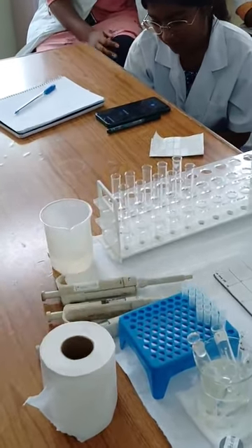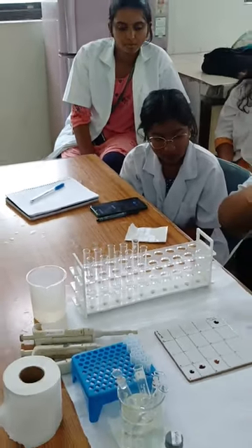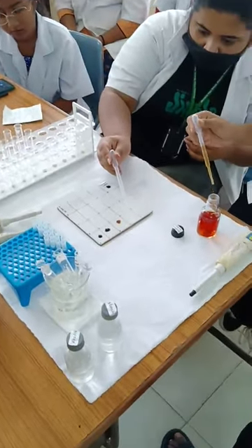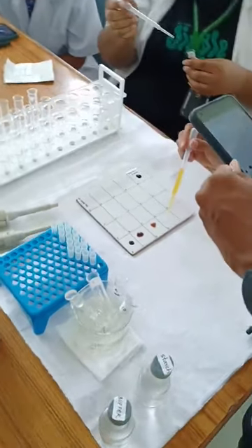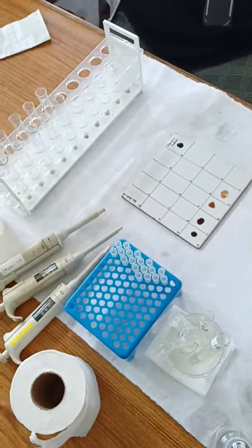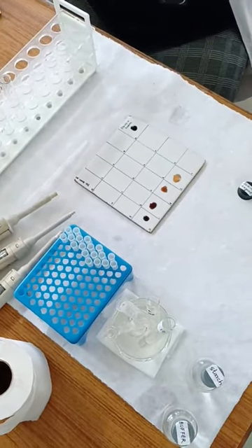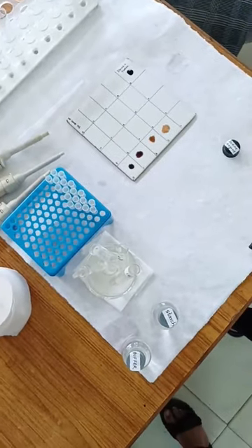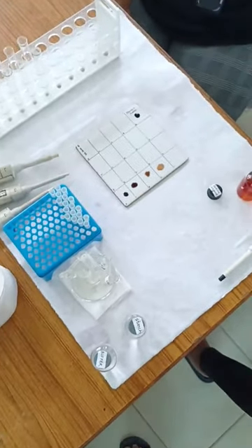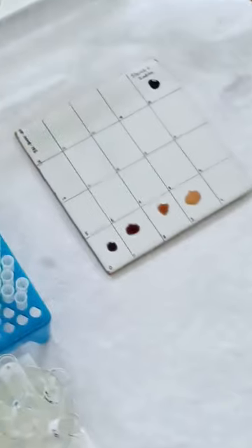This is a simple test to determine the achromic point. Once we find the achromic point, we can decide what incubation time is required for alpha amylase when performing quantitative analysis of enzyme activity using the 3,5-dinitrosalicylic acid method. The color is still forming but the intensity of the purple has started to decrease, and at 3 minutes we can find it appears in the form of a brownish color.